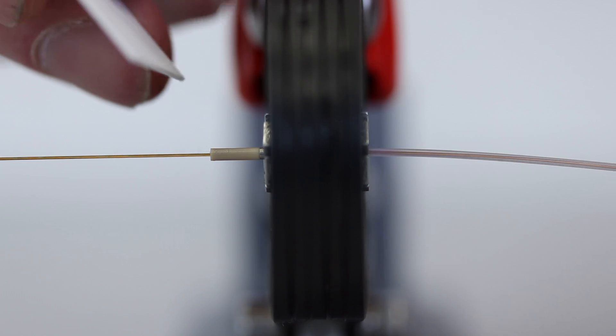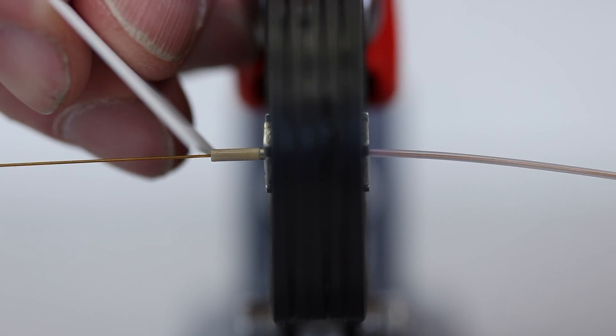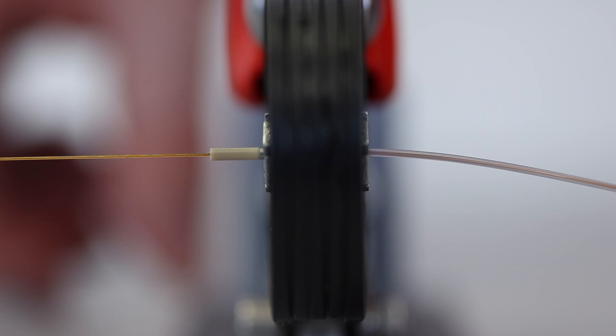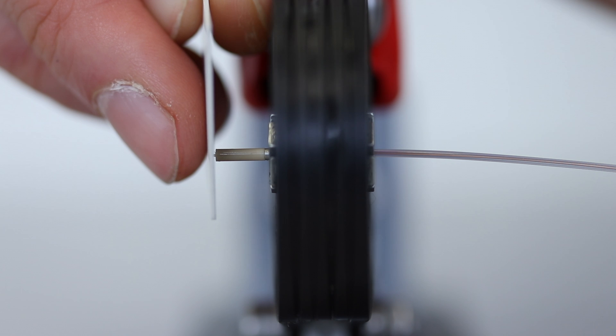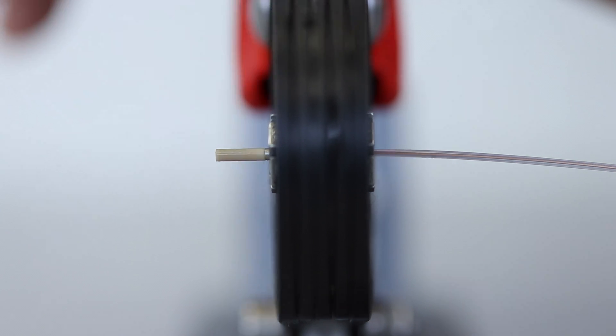Place it on the crimping tool and make a final cut on the fused silica. After pushing the fused silica into the sleeve, use the crimping tool.